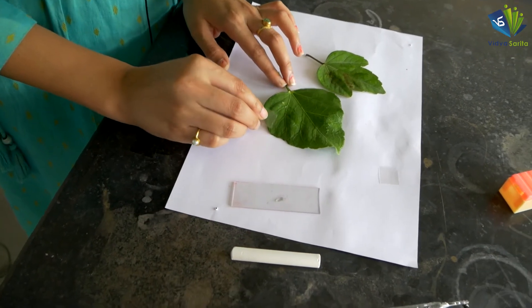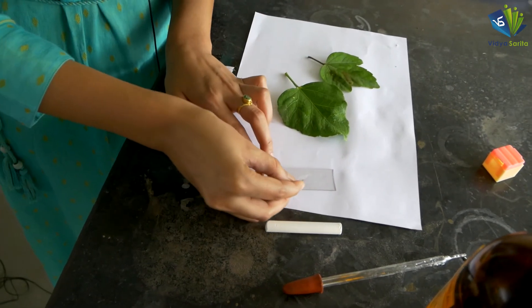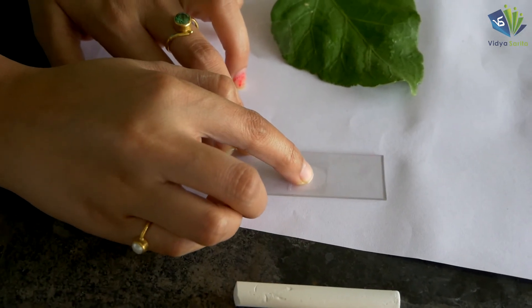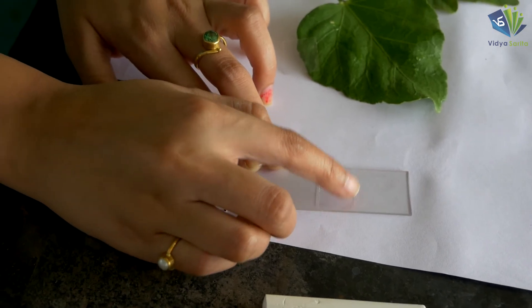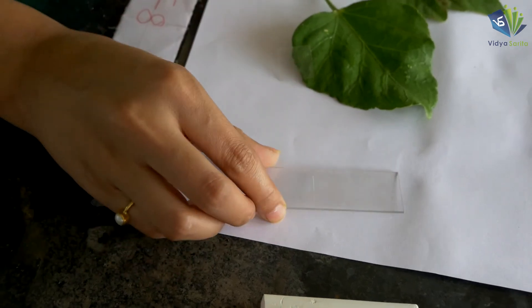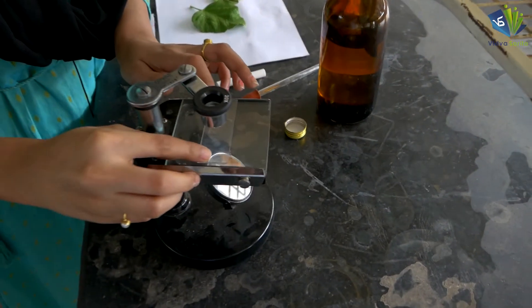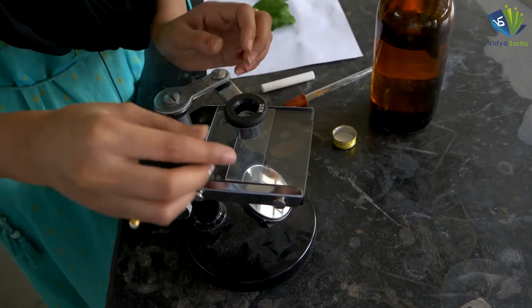Cover the smeared material with the help of a cover slip. Place the cover slip on it and tap it a little bit so that there are no air bubbles. This is our first slide which is prepared. Now put it under the microscope and observe it.